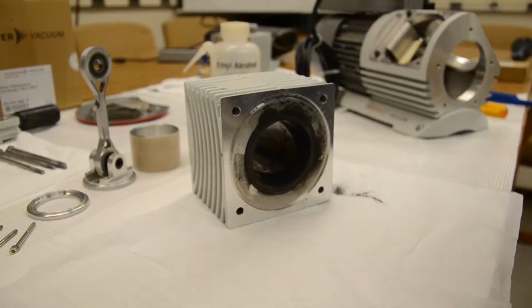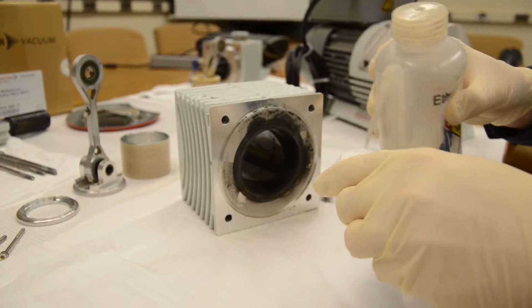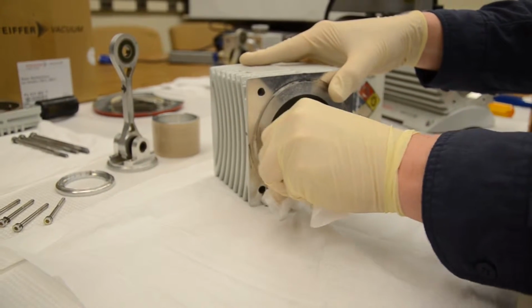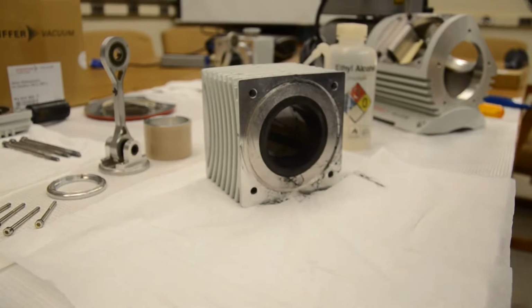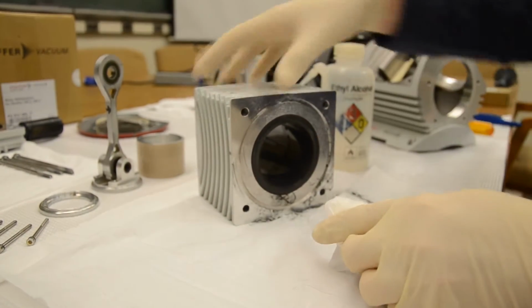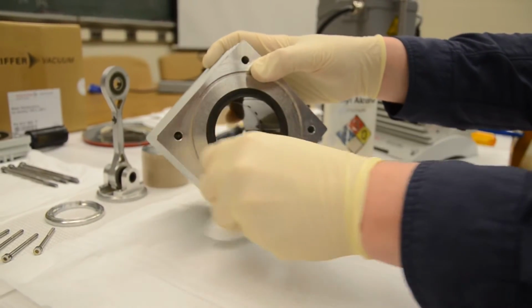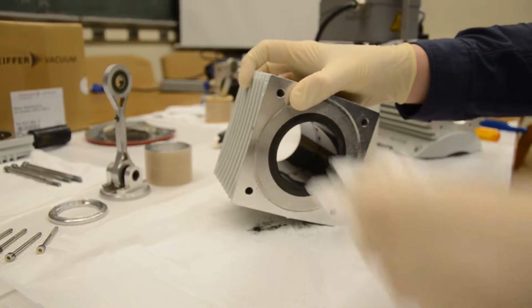So in this case, we're now going to take the Kim wipes and the alcohol, and we're going to need to clean all over and inside of this block. So you can see it has a lot of dust. A lot of it will just kind of fall off. See, it's very black. And we will need to sort of scrub inside with the alcohol. It does come off rather easily, but we do need to make sure that we do a thorough job. Wow, there's quite a lot in there.